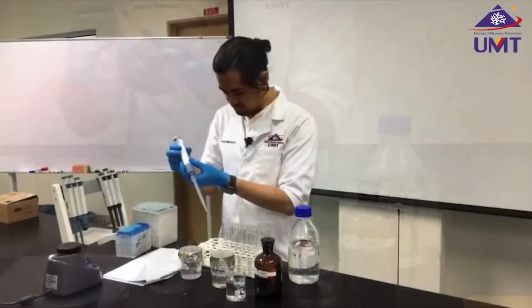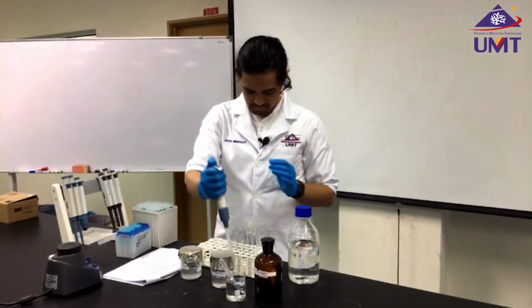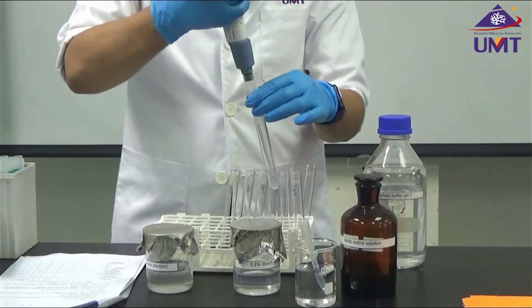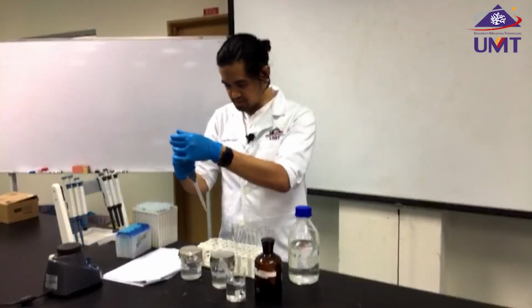The fourth tube, I need 2.9 ml. Fifth tube, I need 2.7.